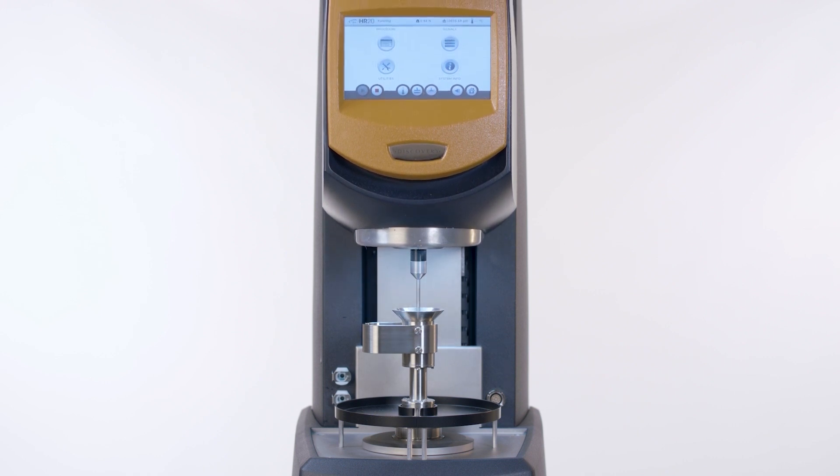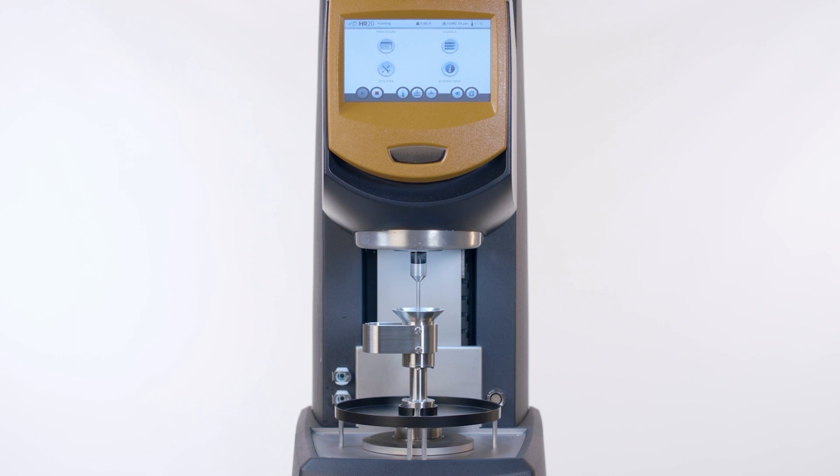The rheometer will then perform a series of unconfined and confined flow measurements on the powder sample as defined in the test procedure.